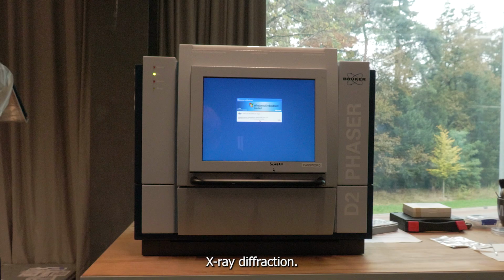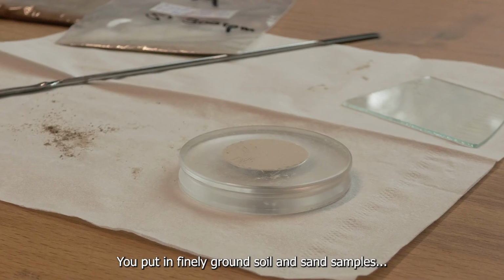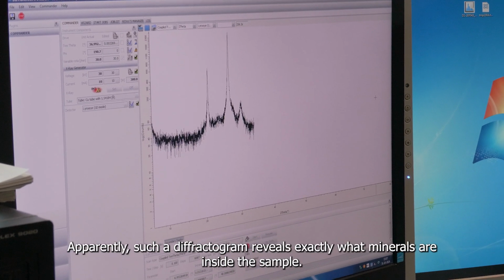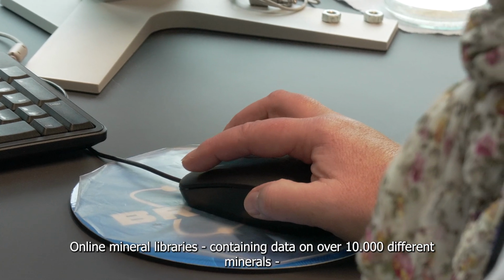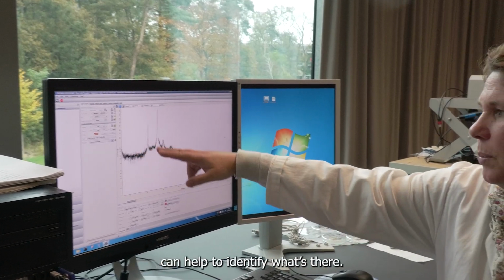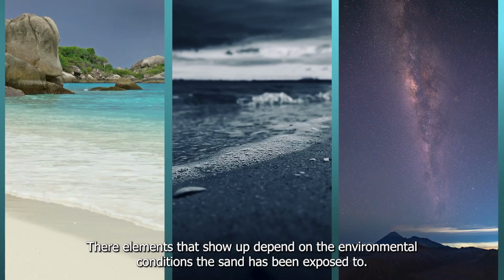X-ray diffraction. A method that uses a so-called XRD scanner. You put in finely ground soil and sand samples, and it returns a graph like this. Apparently, such a diffractogram reveals exactly what minerals are inside the sample. Online mineral libraries, containing data on over 10,000 different minerals, can help to identify what's there. The elements that show up depend on the environmental conditions the sand has been exposed to.